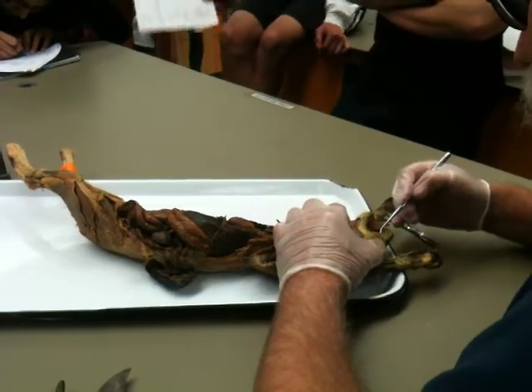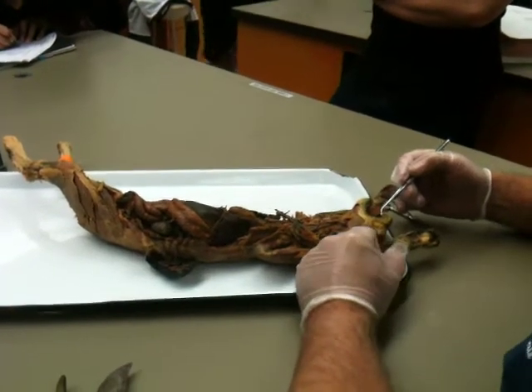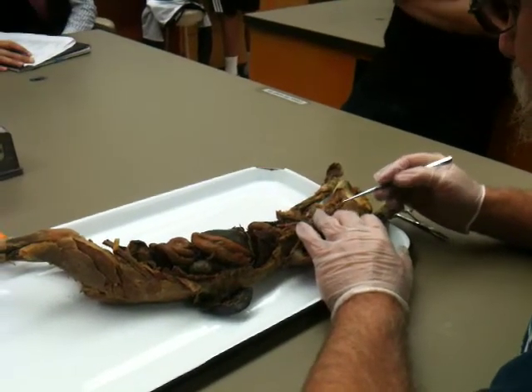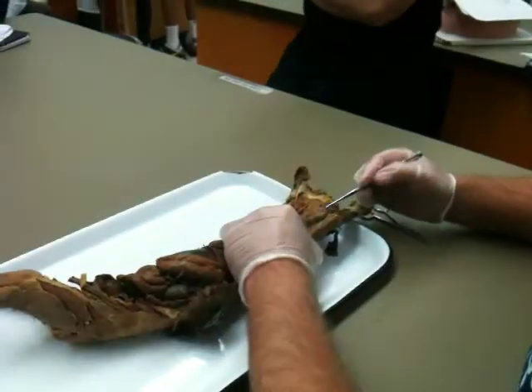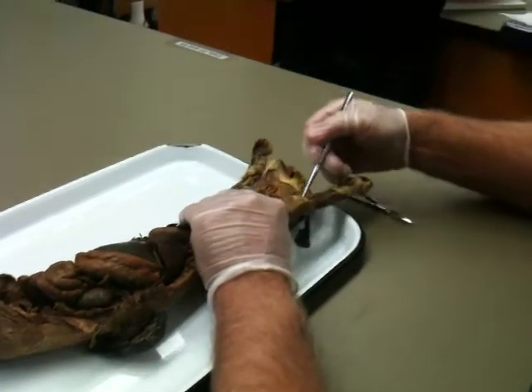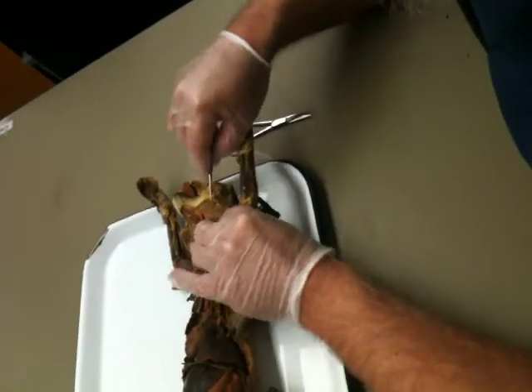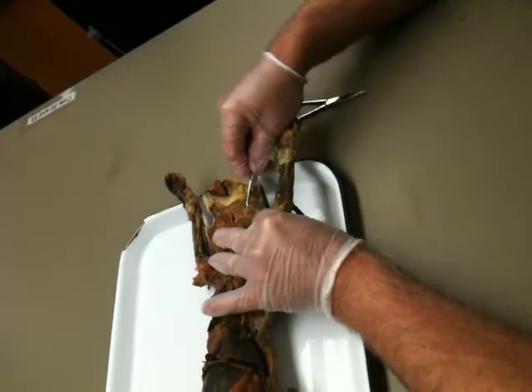And it's into the vestibule that you usually get the salivary amylase from the parotid and submandibular glands being added. This is a parotid salivary gland right up here. It's not as good as you guys can do, and we will get these cats out next week. If you'd like to do it tonight, you may. But this is the parotid salivary gland. I'm just trying to free it up a little bit.